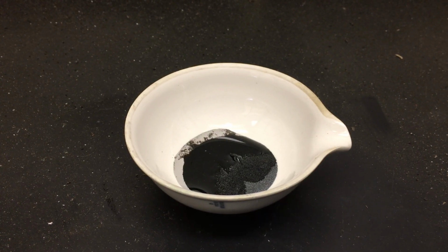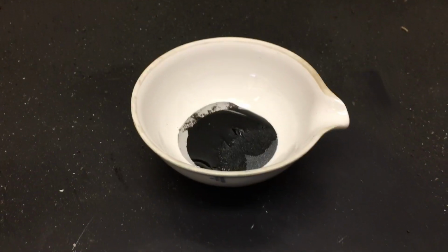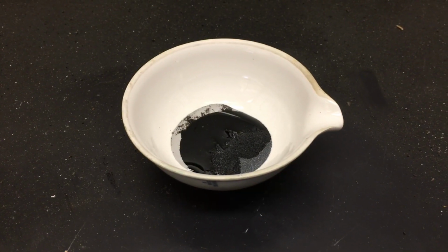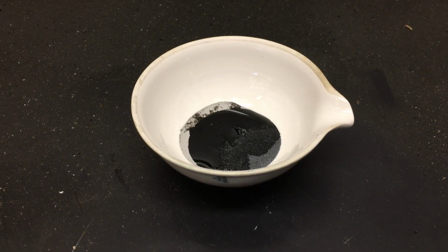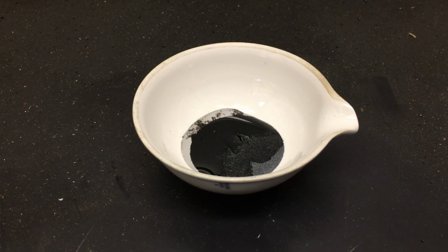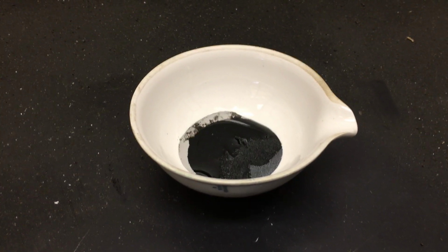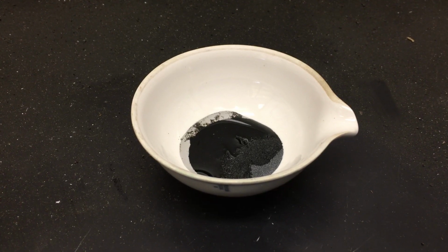So far, it doesn't seem like much is happening, right? And you might wonder, did we get a dud? This is why I wanted to start it and let it go for a little bit.